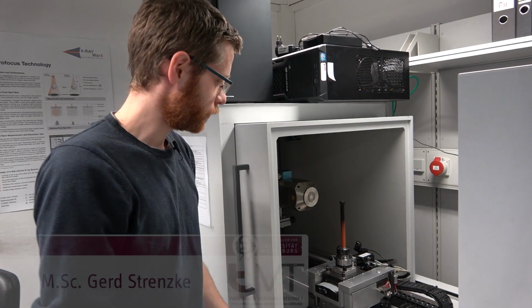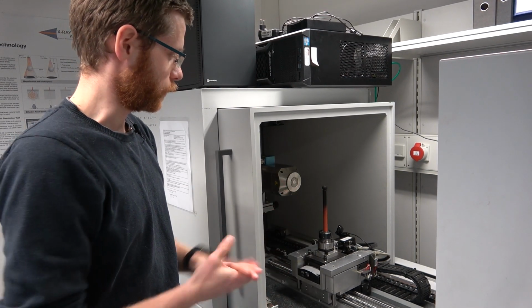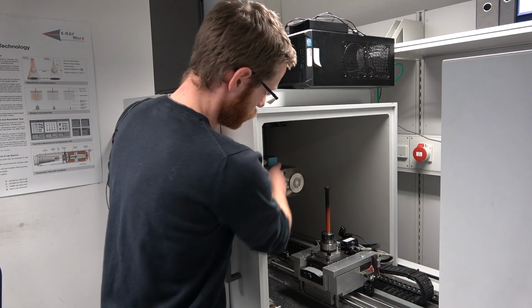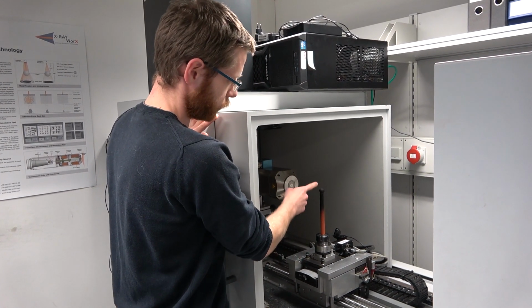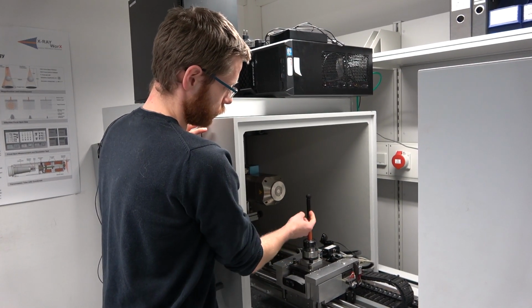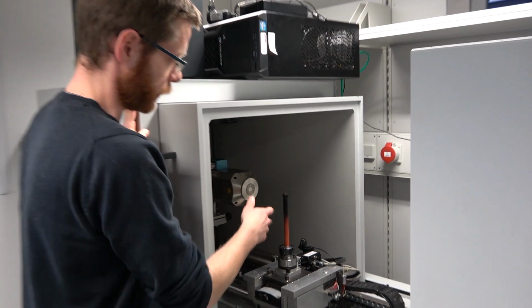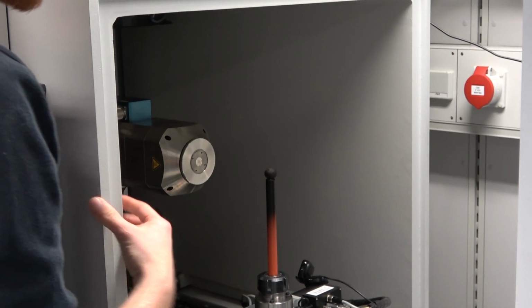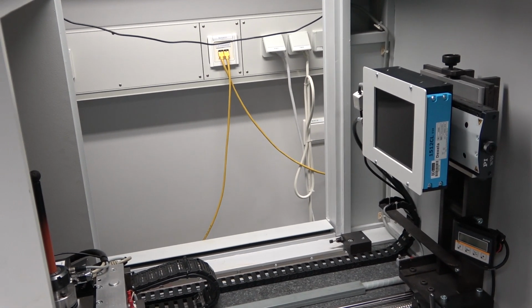Yeah, that's our micro-CT for measuring the morphology of single particles or also packed beds. Here we can see the X-ray source. In the middle is the sample with the sample holder, and we have a movable carrier, so the sample will rotate in our case, not like in the hospital where the device is rotating around the sample. And at the end we have the detector, which is collecting the radiation.